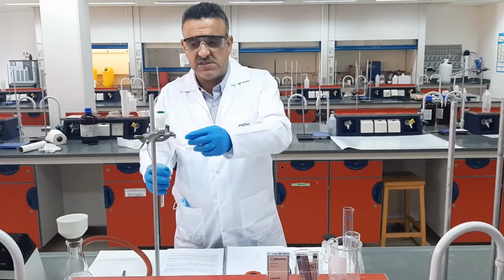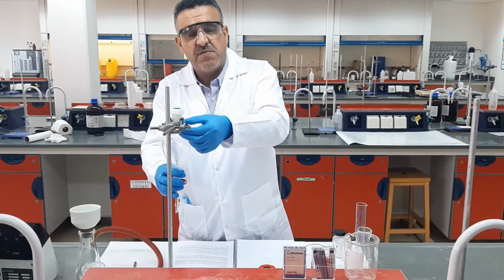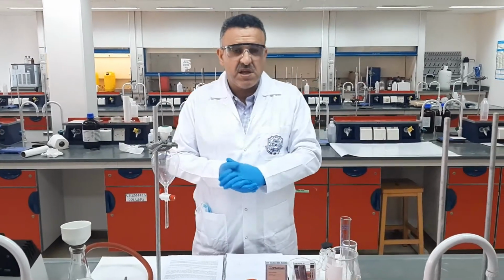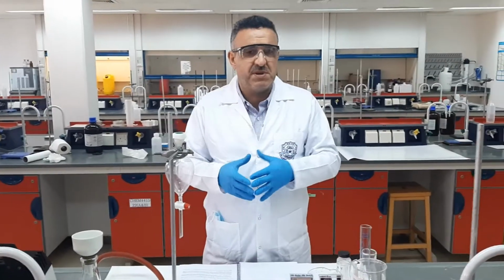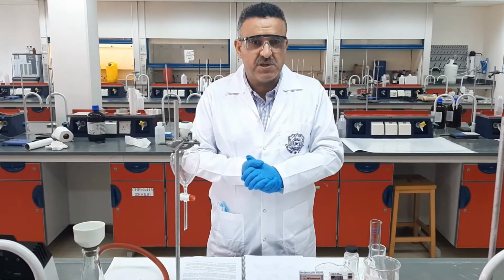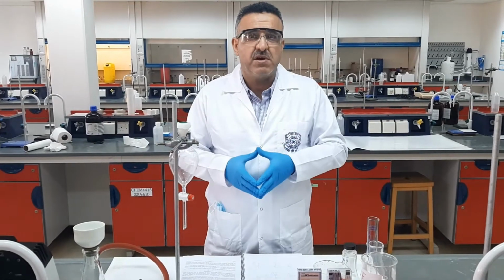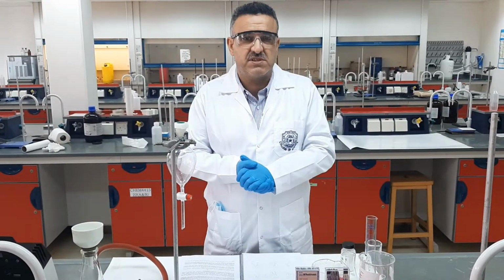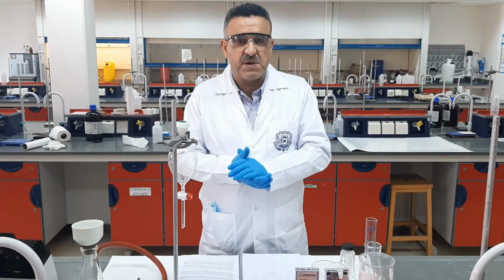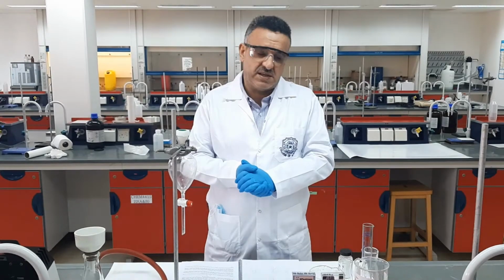Actually, as you can see in your manual, the criteria for the two immiscible liquids is that they shouldn't dissolve each other. And generally speaking, of the two immiscible liquids, one will be water, or what we call aqueous solvent, and the other one is the organic. Most organic solvents do not dissolve in, or are immiscible with, water. In this experiment, the two solvents will be the water and the ethyl acetate.